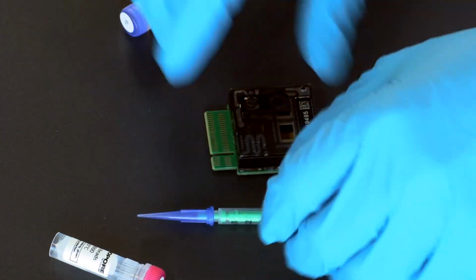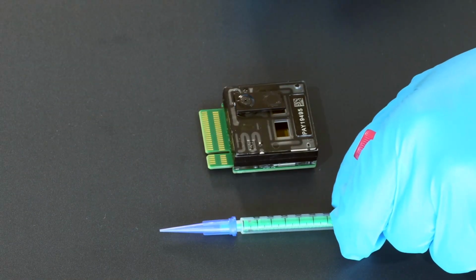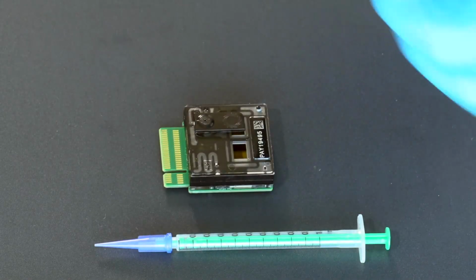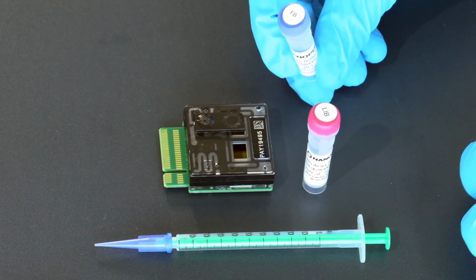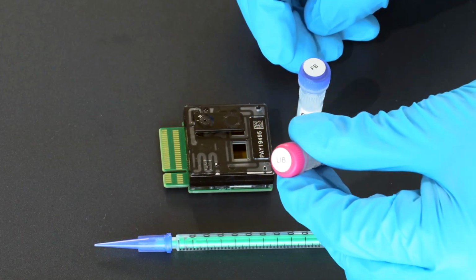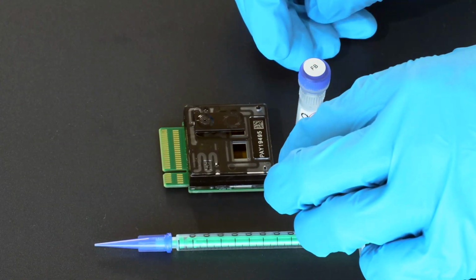What we have inside of the pack is our flow cell, the star of the show today, the syringe with a pipette tip on, which we will use instead of our pipette, as well as two tubes, one with a blue cap labeled FB, flush buffer, which we will use as our flow cell priming mix, as well as another tube labeled LIB with pink cap that we will use as our library. This contains the library loading beads.